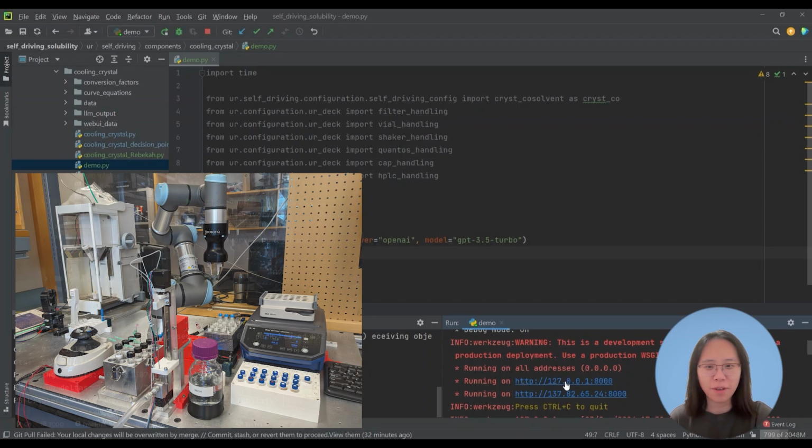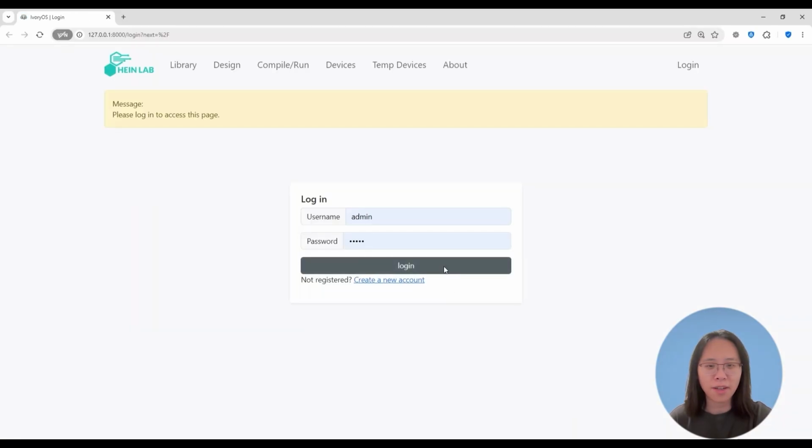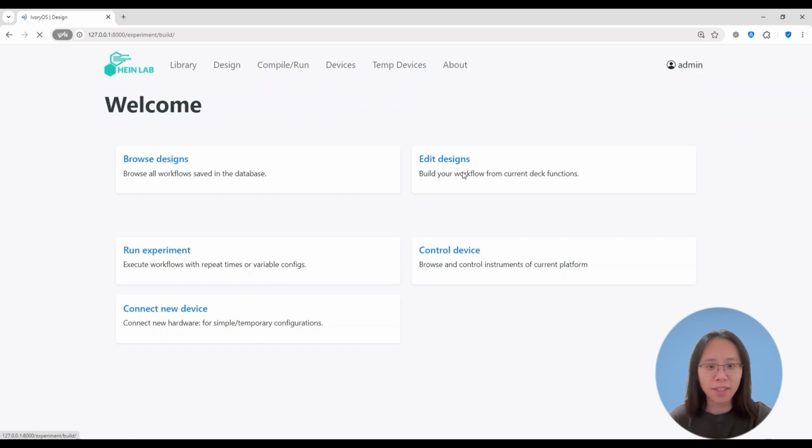In this section, I will use the actual robotic platform to demonstrate how we can use Ivory OS to design and control the external workflow. In this current Python script, I have a couple of instances imported from the main workflow, including the high-level experimental ready-to-run module and a couple of hardware handlers. And in the same script, I import ivoryOS and start building the web UI on this current Python script. I will skip the login part and go straight to the workflow editor.